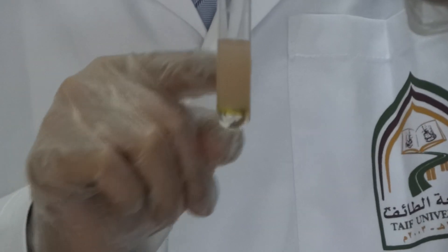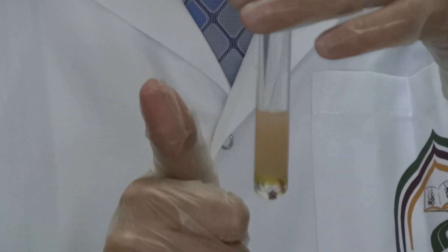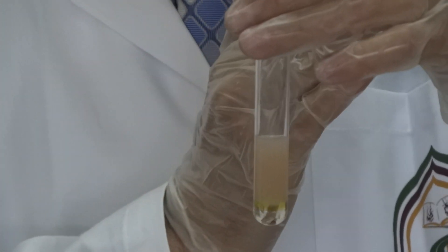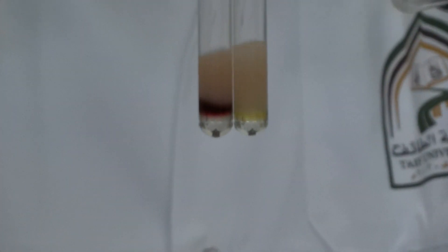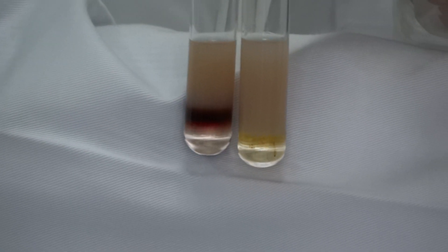So, this is what you should get if you don't have carbohydrate. Have protein, amino acid, anything else. So, let's put the tubes next to each other so that we can see clearly the difference. I think now it's very clear.